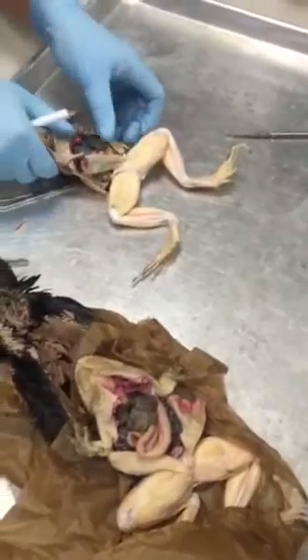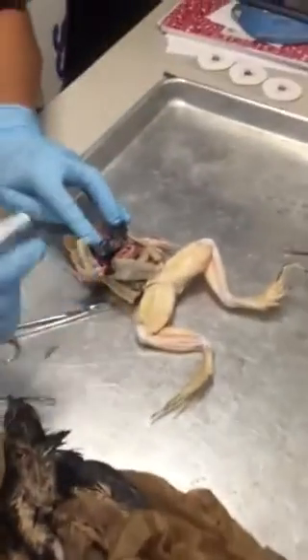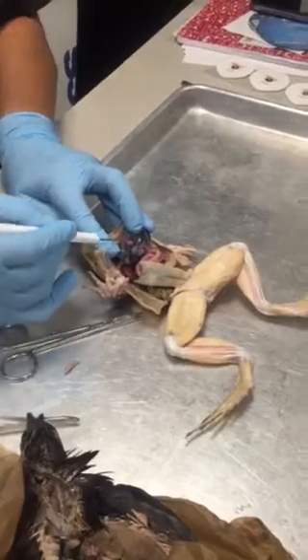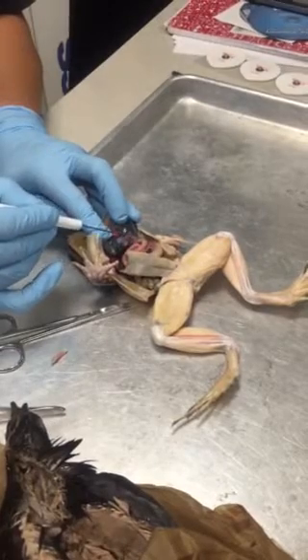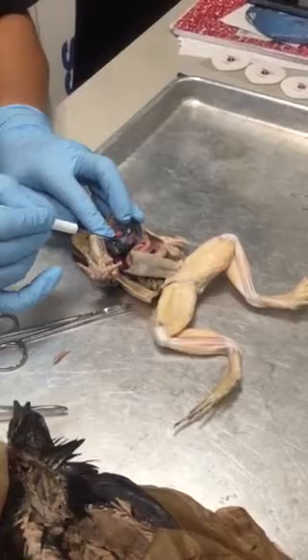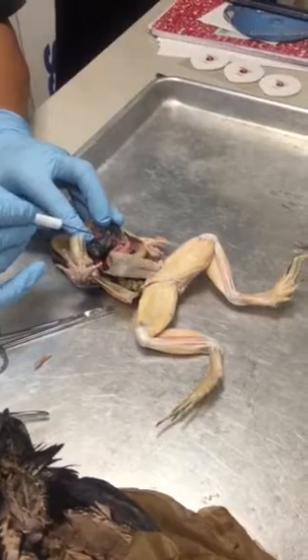Okay? After that, we're going to look for some landmarks. We're going to peel up the liver and look for the gallbladder. The gallbladder will tell us where a few of the arteries and veins are. First of all, the big blue vein that's running along the surface of the liver here is the hepatic portal vein. Now, right along with it, you can see this pink artery right here.